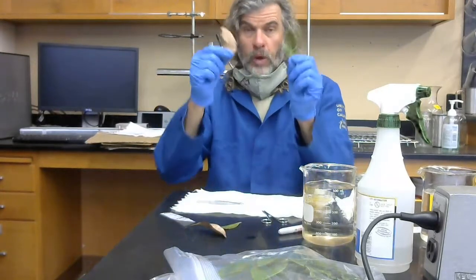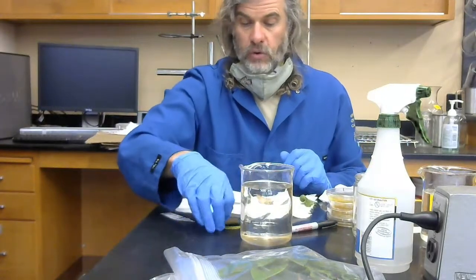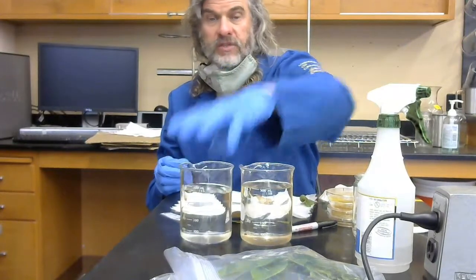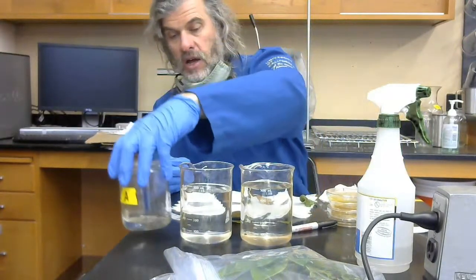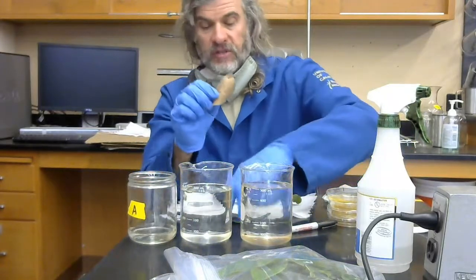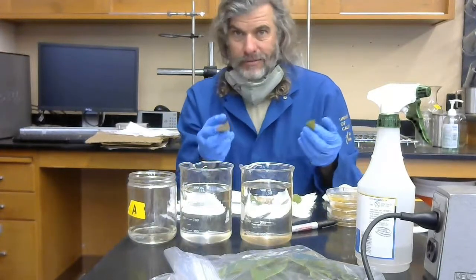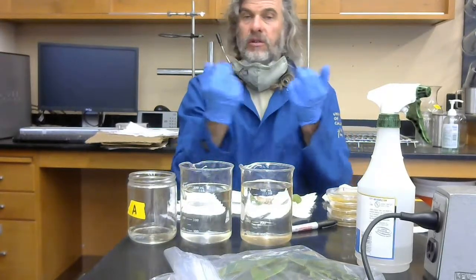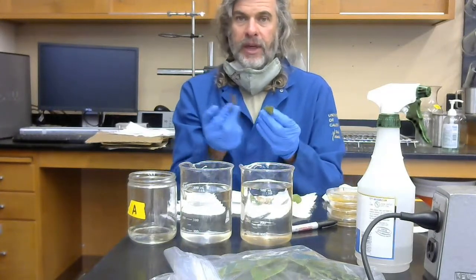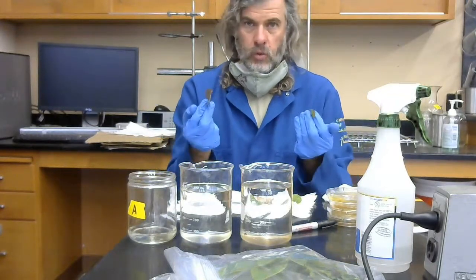All right, once you've done that field portion of your sampling, we're going to need to surface sterilize your leaves. This step is done in order to get all things that just happen to be on the surface of your leaves off. There are many microbes, lots of bacteria that are on the surface of the leaves, and they're there by chance. They're not associated with the biology of the plant. They're not the saprotrophs, mutualists, or pathogens that we're actually interested in quantifying.